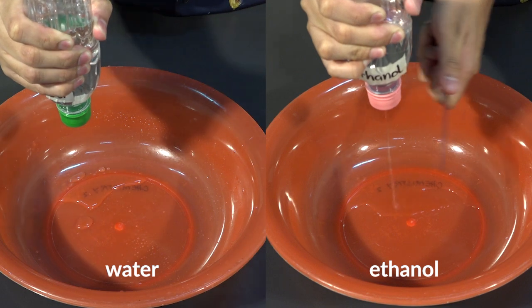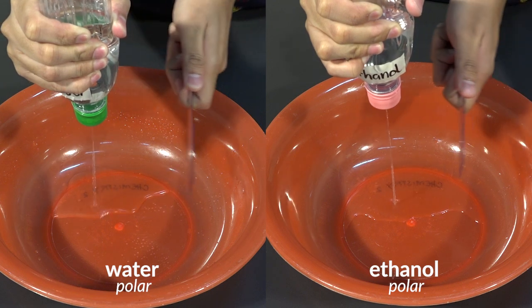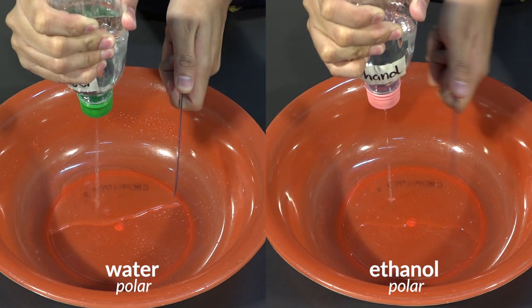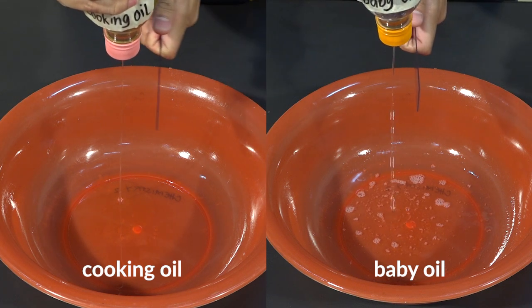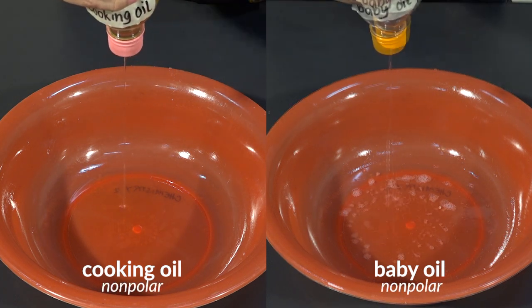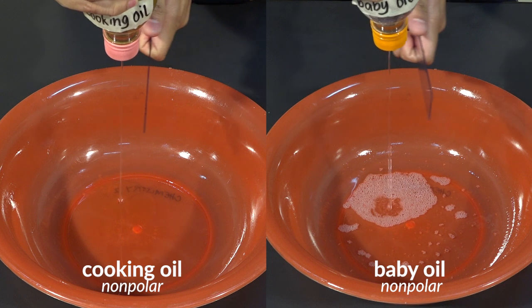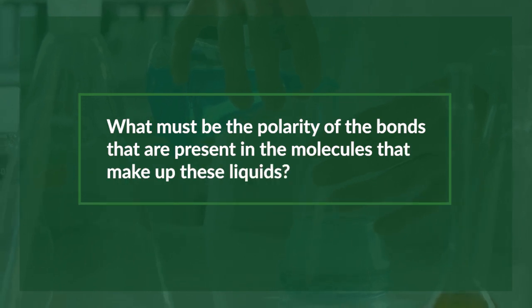One inference is that water and ethanol are both polar liquids. They move toward the charge ruler because of their partial charges. The other inference is cooking oil and baby oil are non-polar liquids with no net dipole moment. Thus, they did not move toward the charge ruler. Now, what must be the polarity of the bonds that are present in the molecules that make up these liquids?